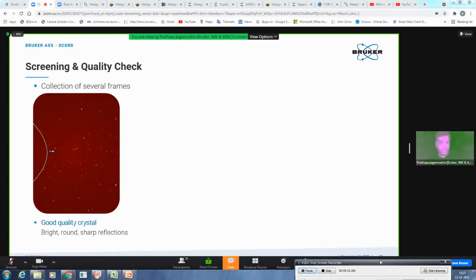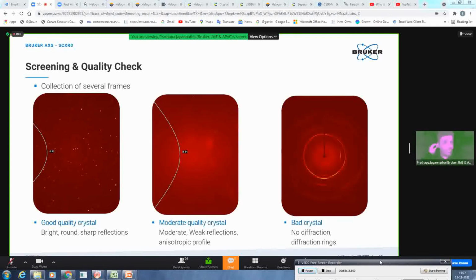Okay, so Karsten has put us on data collection. Just one slide I wanted to explain for the beginners: if you're screening the crystal at the beginning, and you see an ideal single crystal, you should see well separated, discrete, spherical spots. That's an indication of a very good crystal. If you see diffuse and weak spots, you can consider this an average or moderate quality crystal, or a weak crystal. If you can't grow a better crystal, then try to collect the data on this, so you can deal with our software to get improved and try to get something out of it. But if you get something like this, kind of a diffuse ring, then this is not the right machine. You need to measure that in the powder XRD. That's kind of amorphous or polycrystalline material.